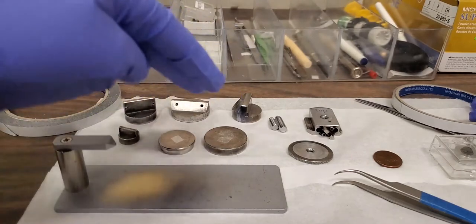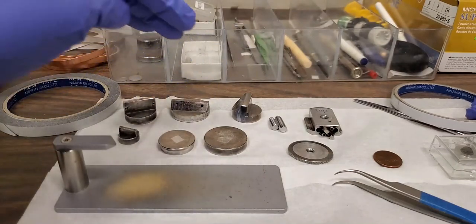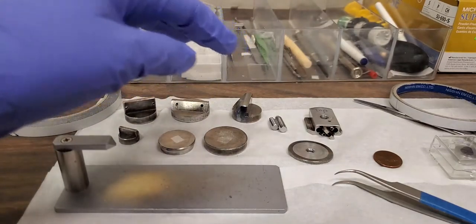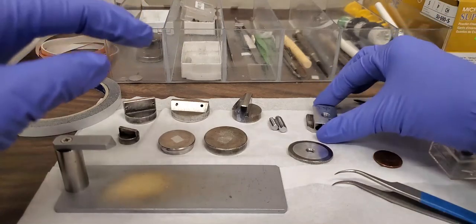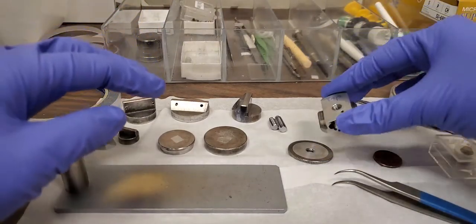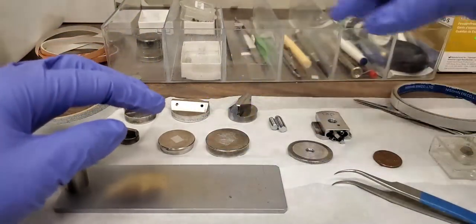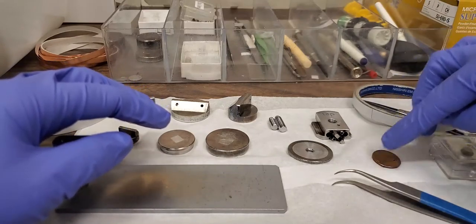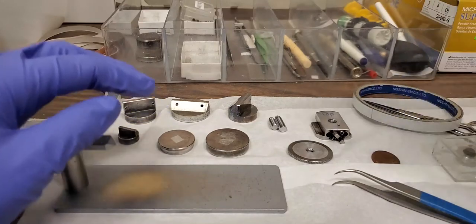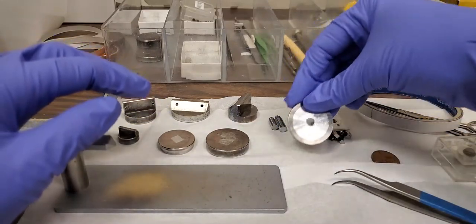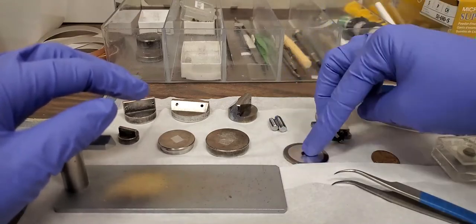So how would we assemble a sample? For example, we're going to need the base holder, a puck, some carbon tape to mount the sample. We'll use the penny for example, this washer and one of these screws.